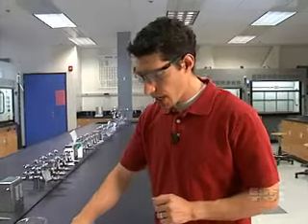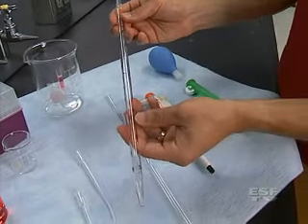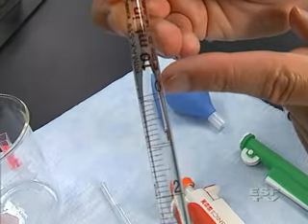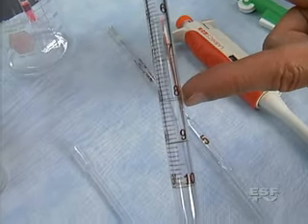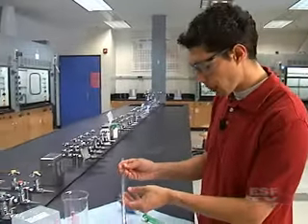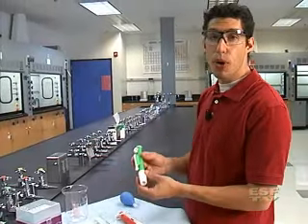If we look at a graduated or serological pipette, it's a little more accurate and also a little different to use. On the pipette we have some numbers and they number a little bit differently than you might expect. They start at zero at the top and then go all the way down in milliliter increments down to 10 milliliters. This is used to measure dispensing, not withdrawing — the difference will become clear in a moment. To withdraw the solution we use a pipette pump.